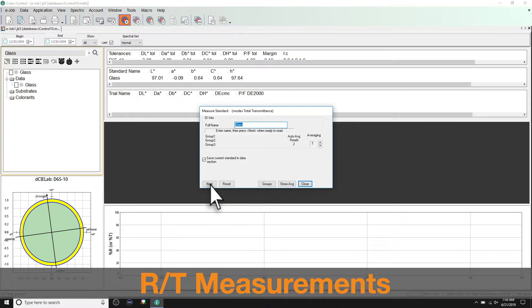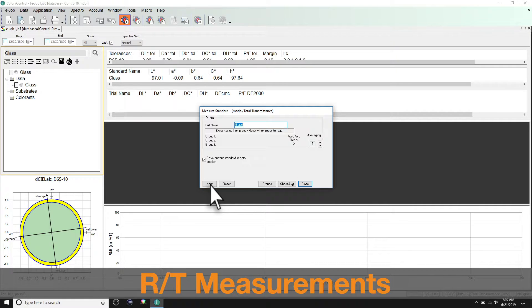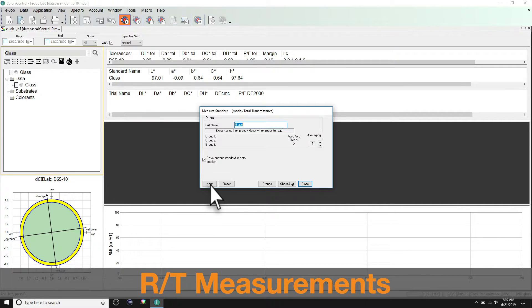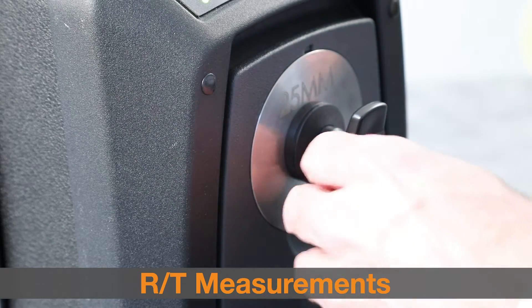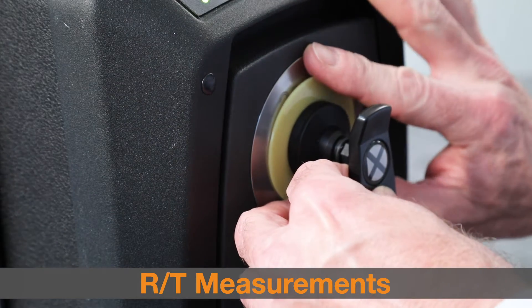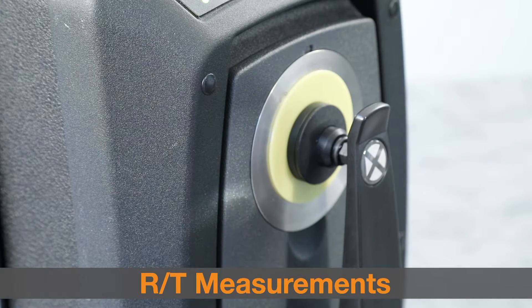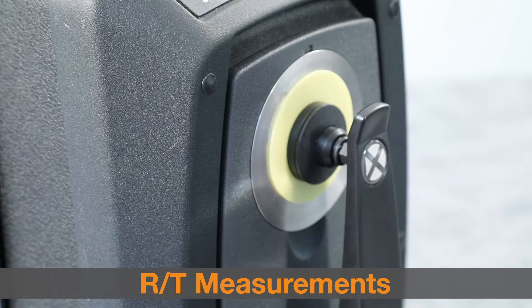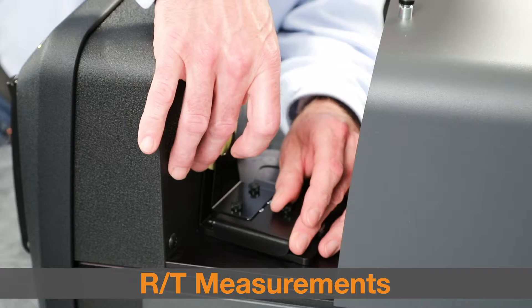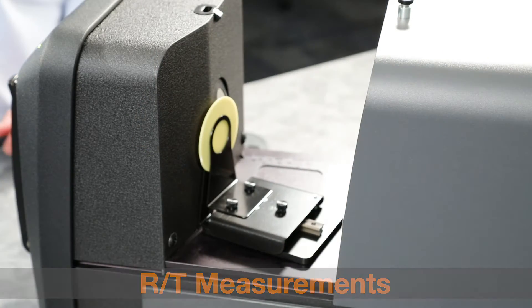Two measurements are taken to create this value. Position the transmission white plaque on the sample holder and then position the sample at the reflection port, as explained in the video on reflectance measurements. Initiate the measurement. To take your second measurement, follow the same procedure used for total transmission measurements.